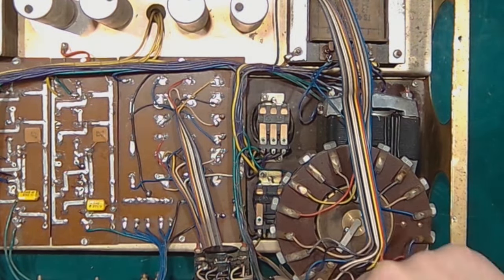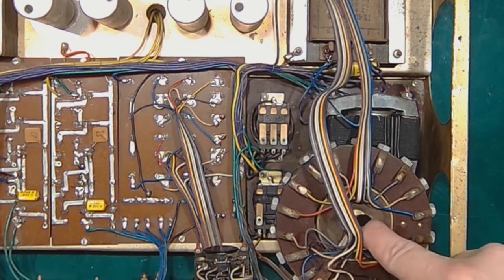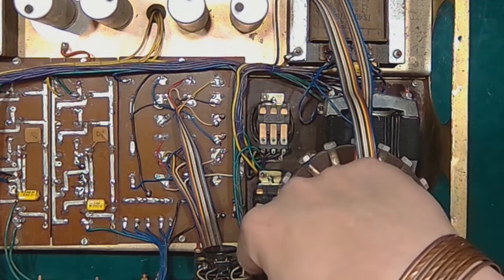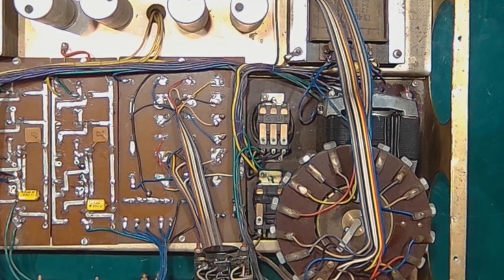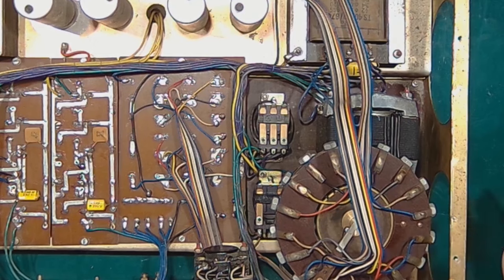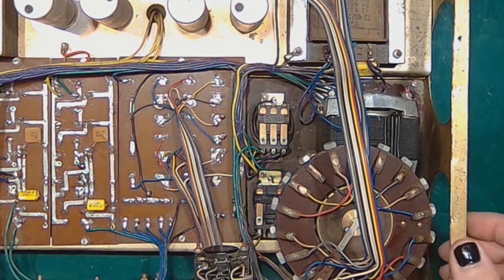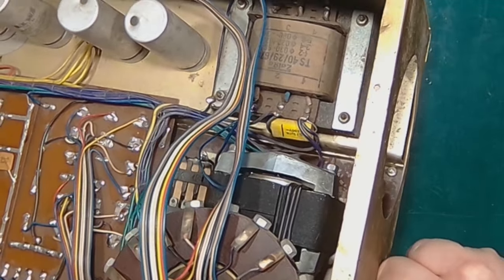And how it works, when the rotor is rotating, it connects the upper contact to a group of eight carbon brushes on one side, while applying the other contact, the ground, to the group of brushes on the opposite side. So in some cases, it will apply one pole to one ribbon and the other pole to the other ribbon, but it's highly improbable. If I turn it, I will make it do so.